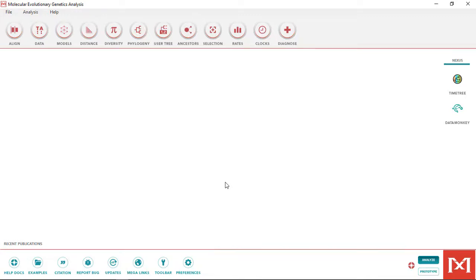I've provided a link to download the software in the lab handout and below, so if you haven't done so yet, now would be a good time. Our sequencing vendor has provided us with the raw chromatogram trace files, and this is what we'll be analyzing. Your instructor has provided these files to you on Canvas, so to start, download the .ab1 trace file corresponding to your SUSHI sample that you are analyzing and save it to your computer somewhere you can find it.